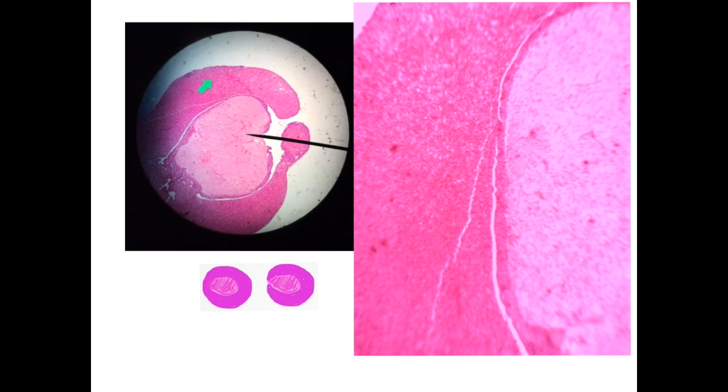Here we have the anterior pituitary, and this is the posterior pituitary. Anterior is darkly stained compared to the posterior, and the structure is very easy to diagnose by its small size and this distribution of colors, the posterior pituitary containing the pituicytes. And here we have the pars intermedia on the surface, and then the narrow cleft here, and the pars distalis.